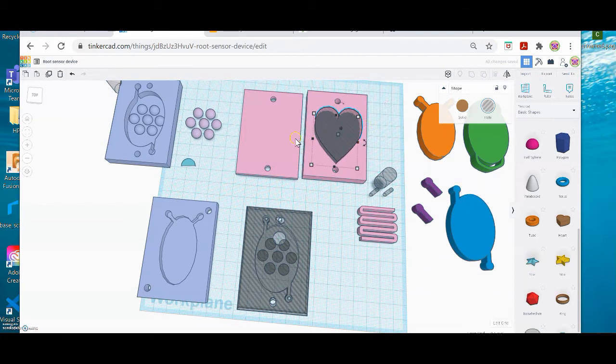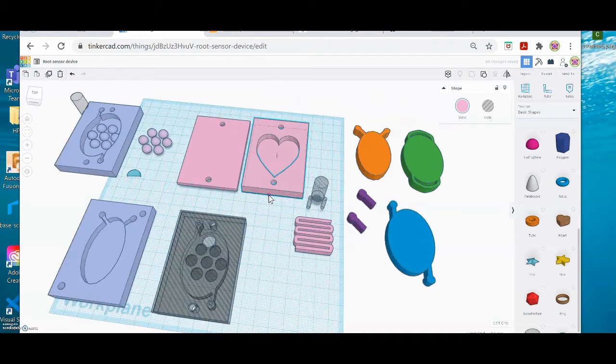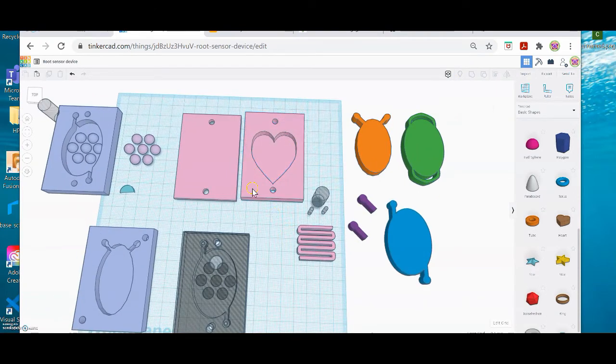Okay, to group this in a way that the whole thing works as a kind of like a chocolate mold hole, I'm going to grab the two shapes and I'm going to go up here to group. And now you can see that that's a cavity in the form, and that's exactly what I want. I'm almost done with my base plate. The next thing is I have to create the ports into which I can drop the fluids. And so that's what these little shapes here are for.